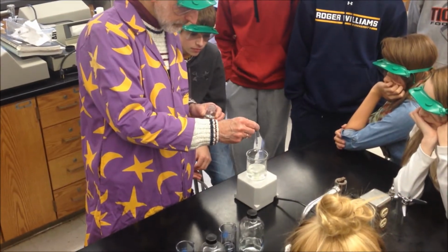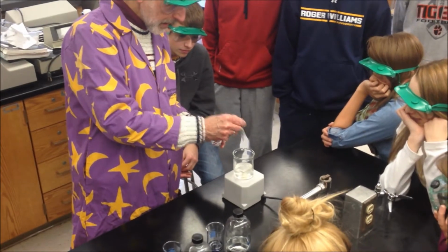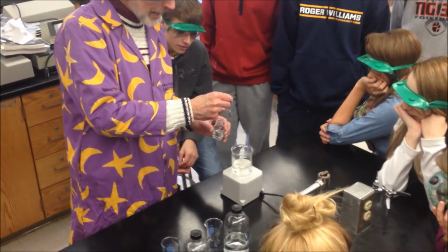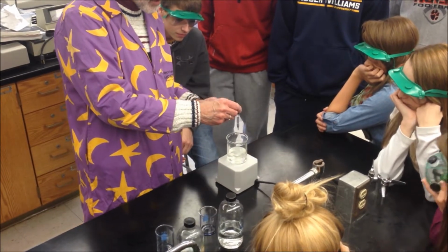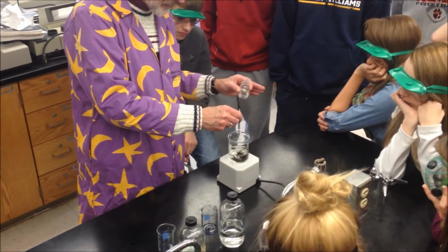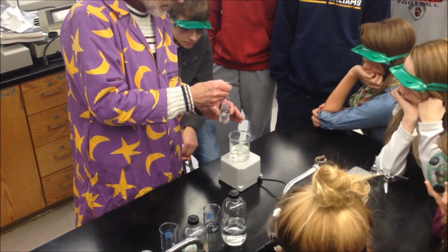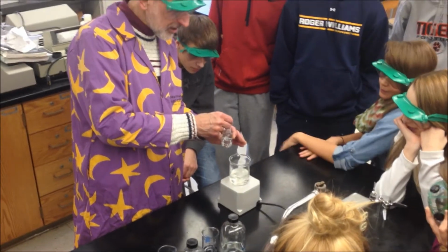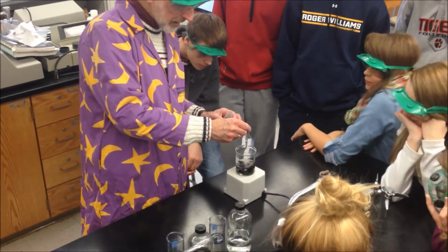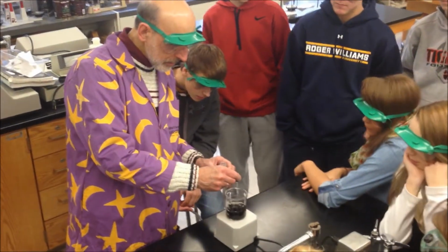Wow. That's so cool. It's a series of competing reactions, very complicated chemistry, which is why on the one hand it seems to take a lot of time, but when it happens it's instantaneous. So there are a lot of different clock reactions, and you can adjust the clock, meaning the timing, based on things like concentration and temperature, so we'll learn about it.